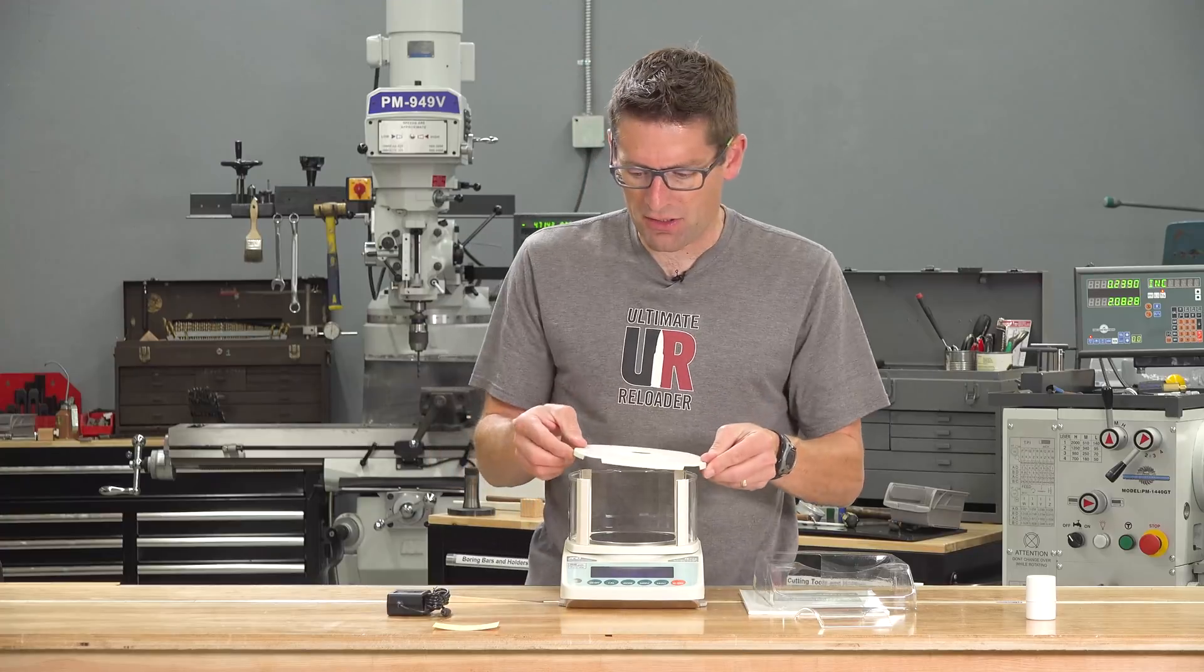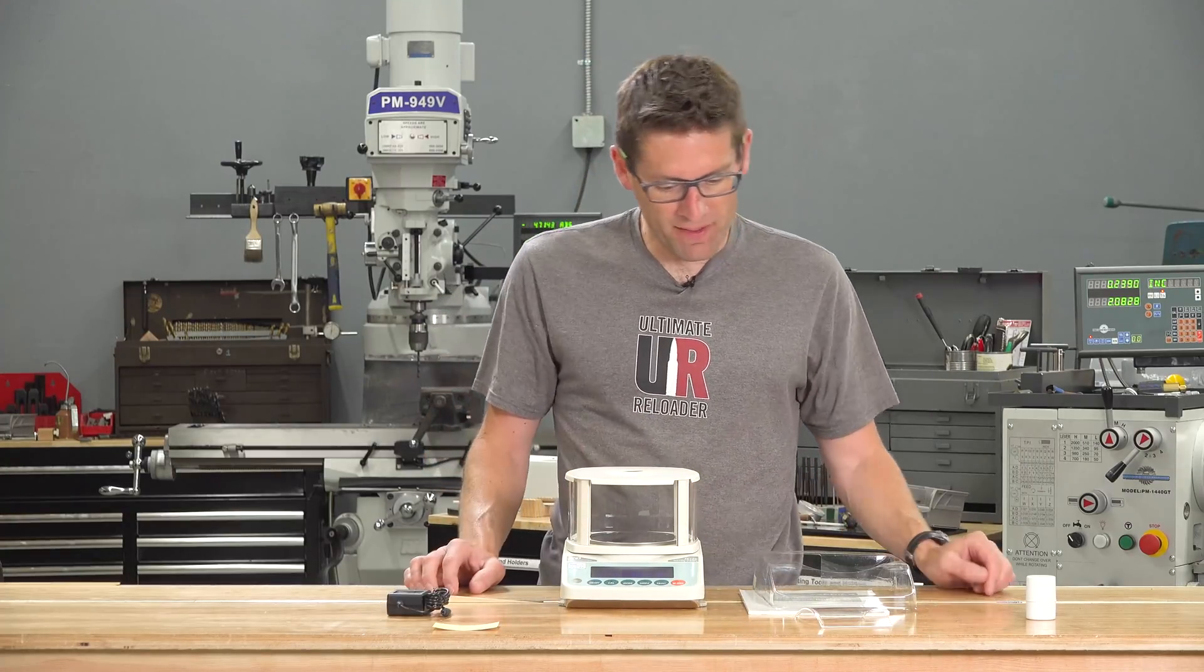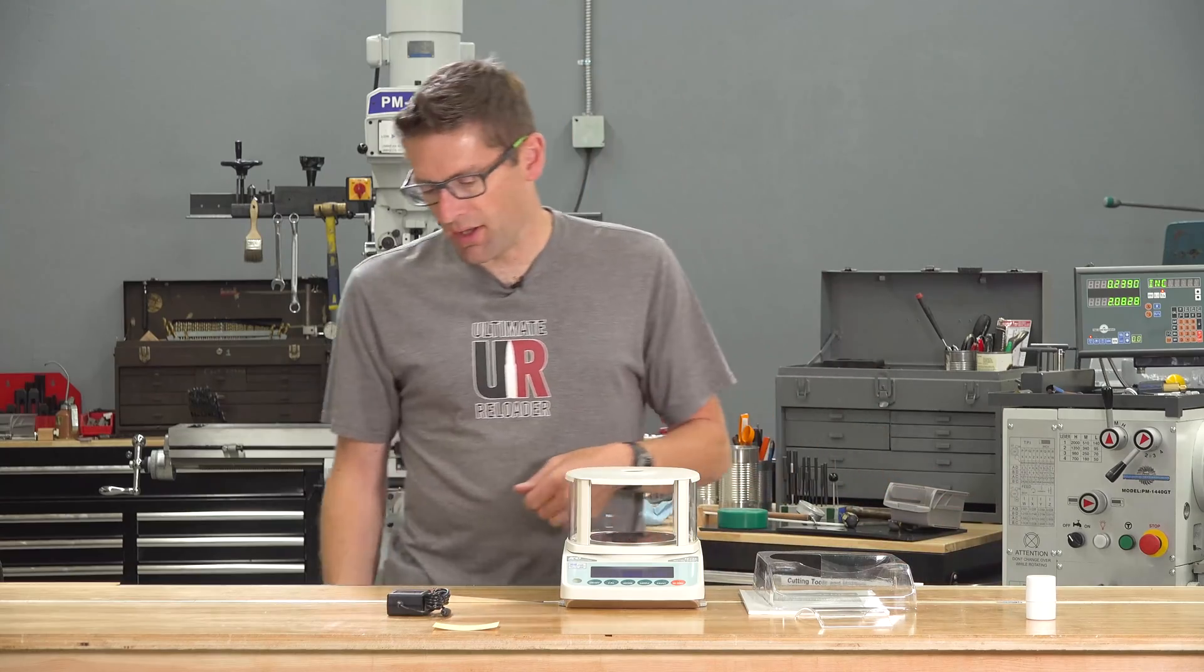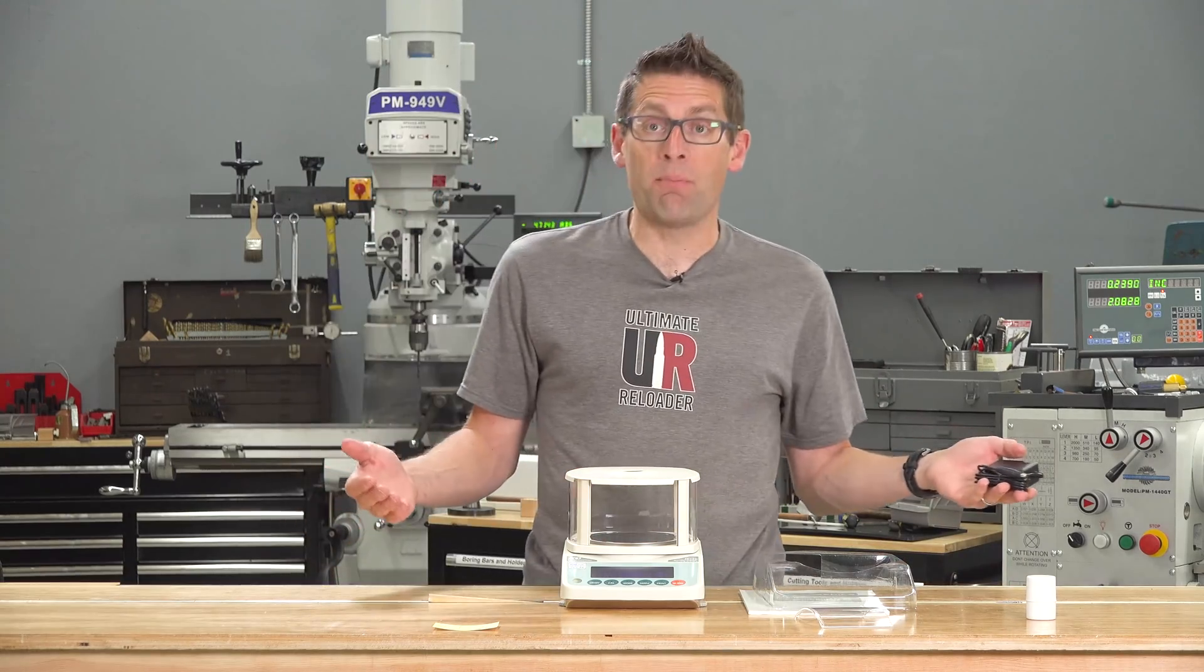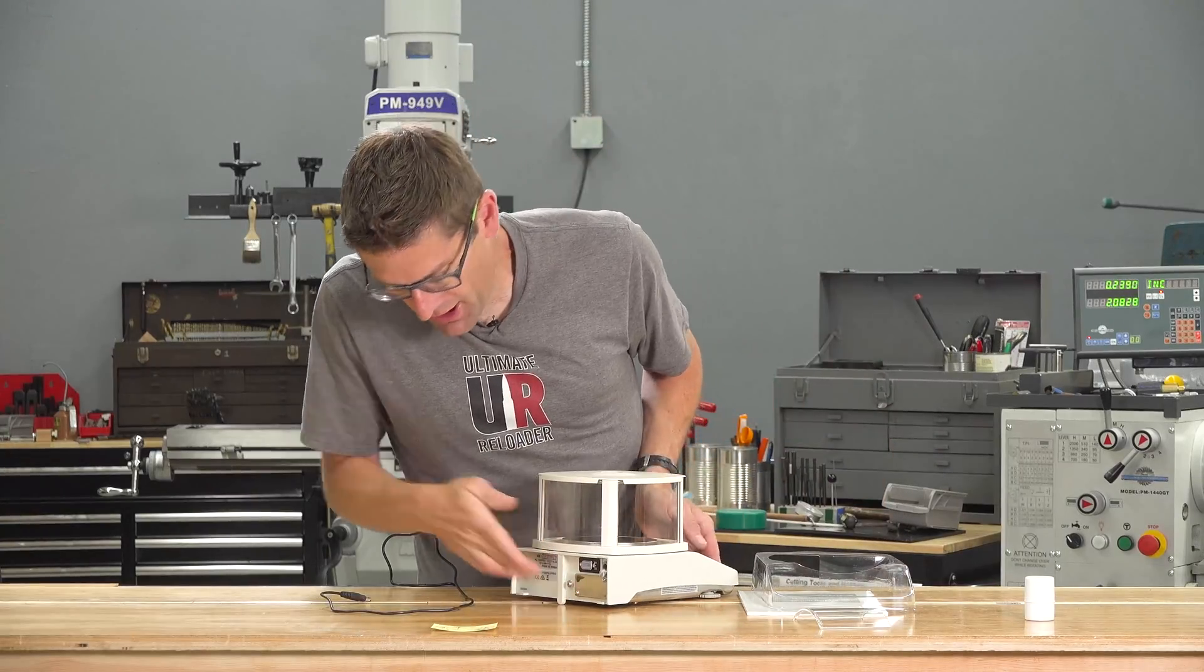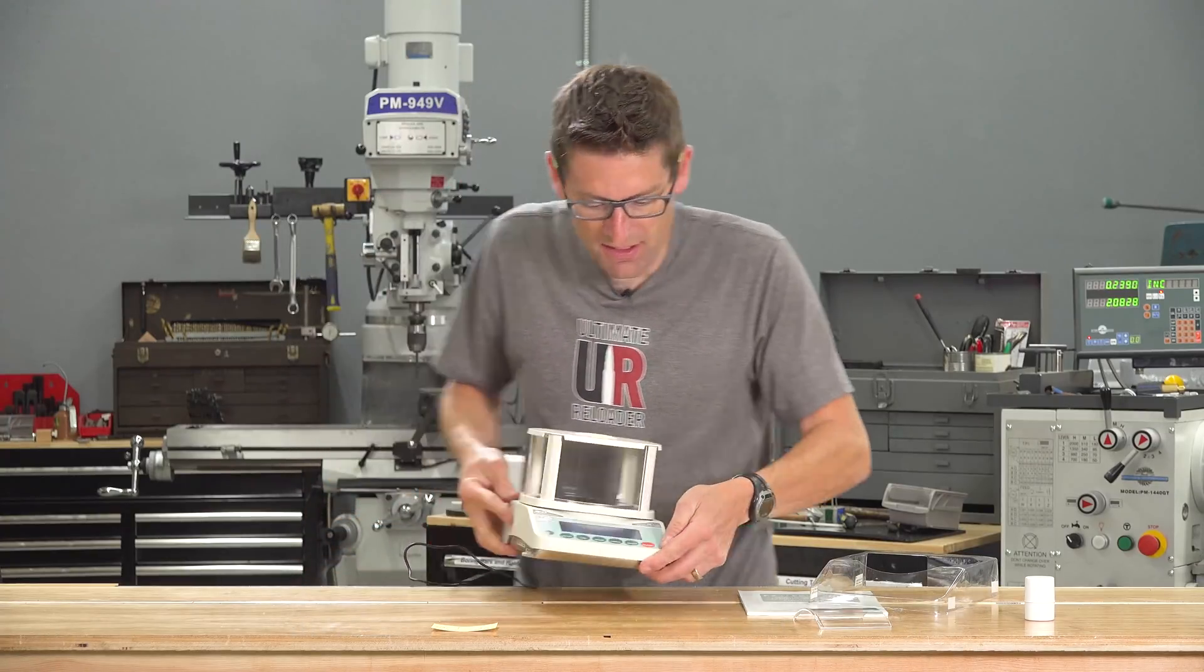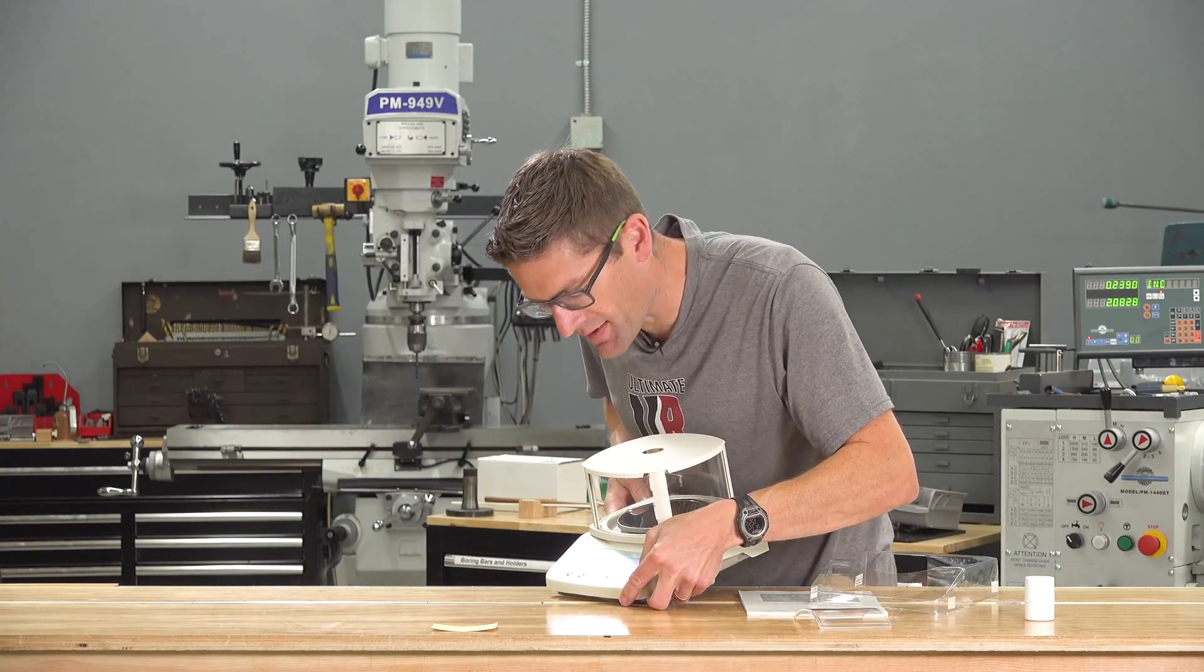And for Adam's auto trickler, the auto throw is going to actually mount right through that hole there. So the assembly is really easy, and then next we can power it on. So the power jack is around the back here. I have this plugged into AC power. And we'll go ahead and plug that in, our display lights up.